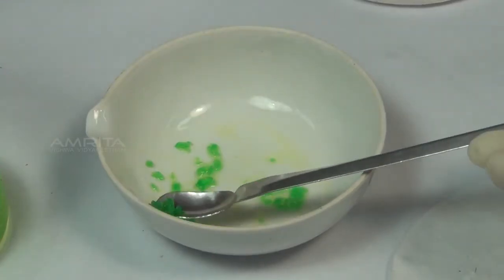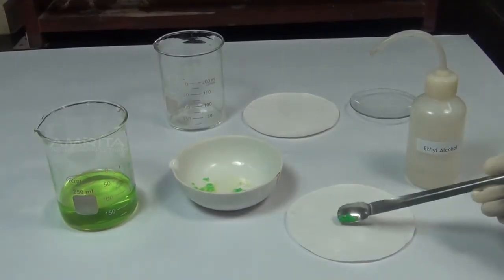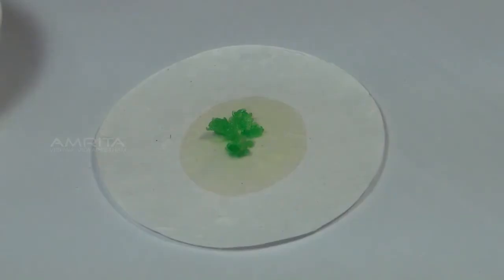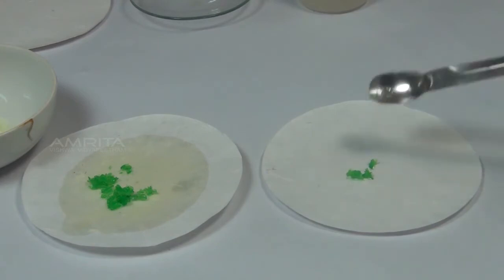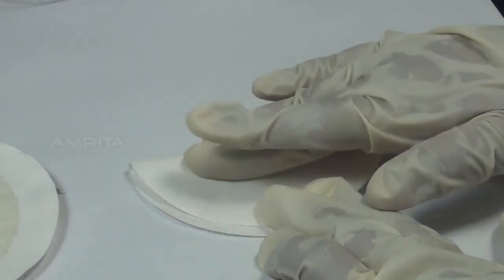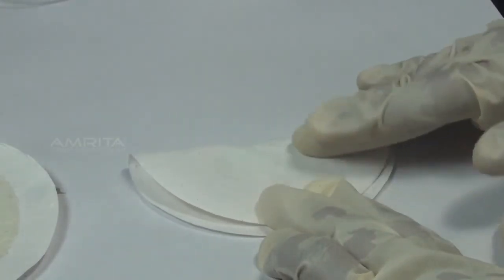Using a spatula, remove the crystals to a filter paper which soaks up the solution. Transfer the crystals to another filter paper and dry them by pressing gently between the folds of the filter paper.